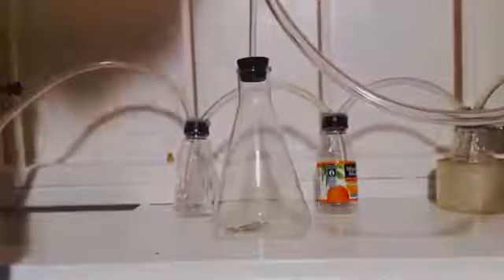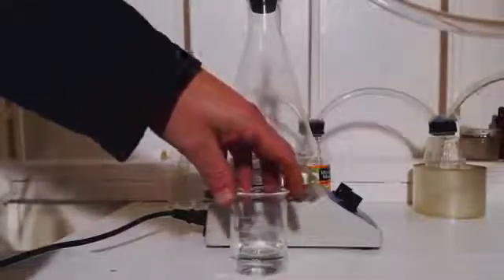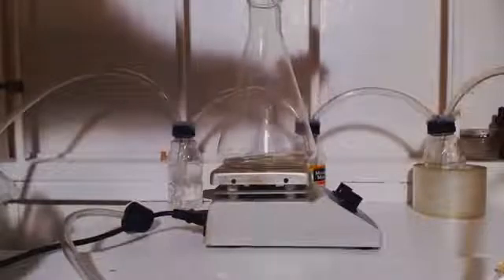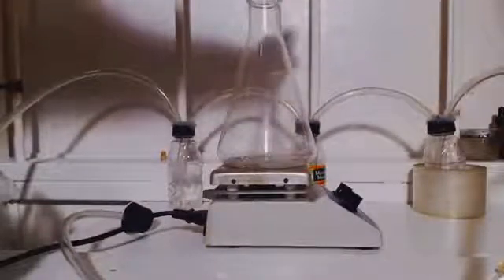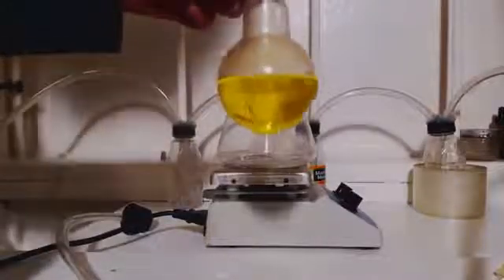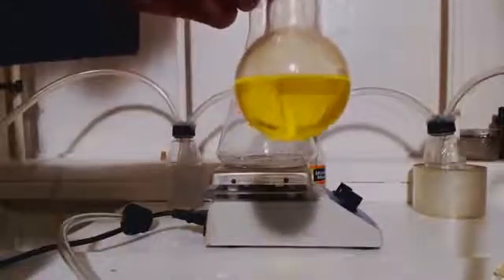Now when I add the nitric acid, it'll start reacting. It'll make the oxides as you'll see soon. So as you can see, I got 30 milliliters of water. I'm gonna put that in here first.